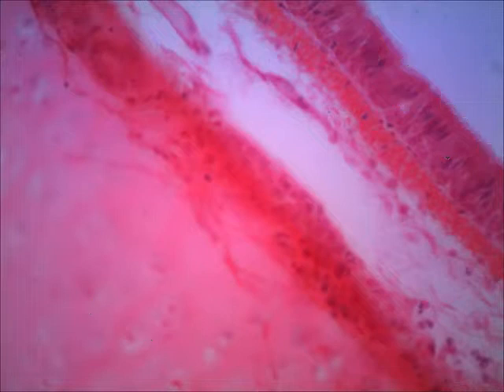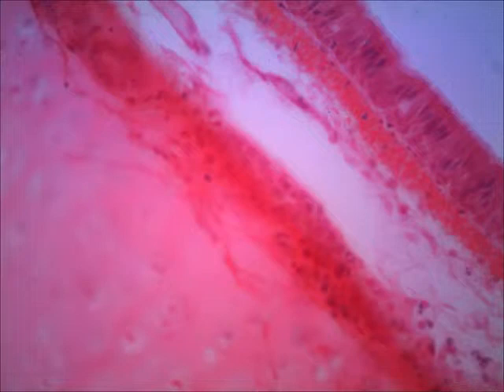Let's erase the arrows. And this would be as if you were moving your fine adjustment knob going from one area of depth on the slide to another. So here the cartilage is in better view, more focused. And then now here the epithelium is in better view because I've moved that fine adjustment knob, and you can see the cilia there.